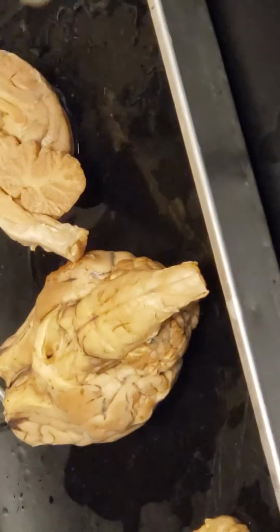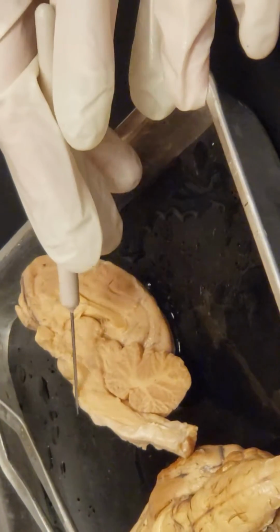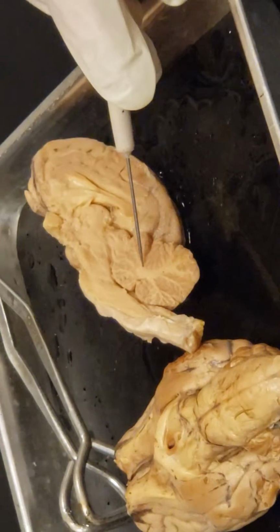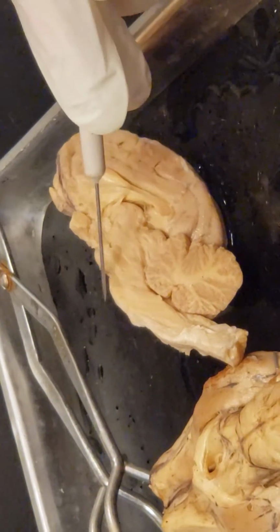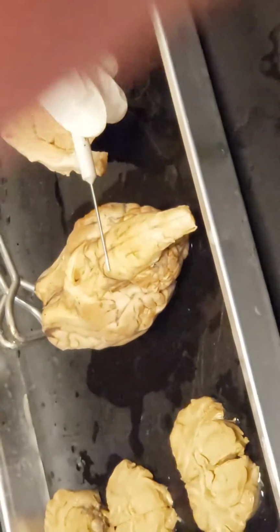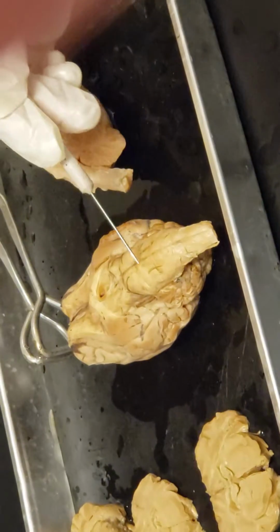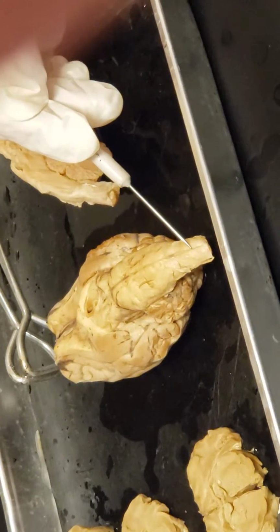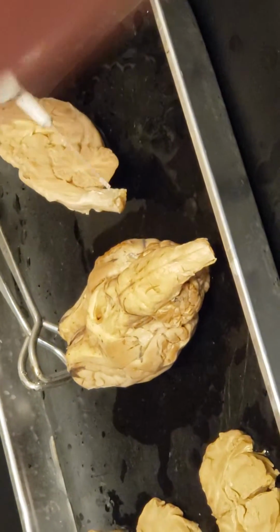And if we look here in cross section, I think it's even easier with this mid-sagittal section that it's going to be this sort of smooth area here. And this lets us see sort of where it is with respect to the cerebellum too. It's going to be pretty close to right across, just anterior to the cerebellum. So that's the pons. And the pons, there's going to be a slight invagination here where we start the medulla oblongata. And the medulla oblongata is going to have a little more width to it than the spinal cord. So it becomes the spinal cord when it passes through the foramen magnum and exits the skull.